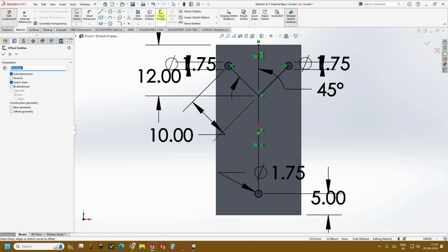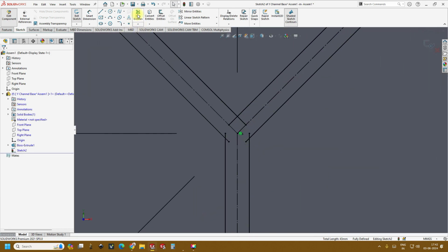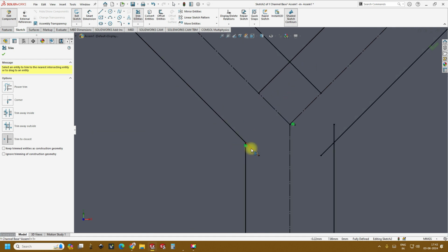You can just create an offset, and here the important note, since we had to create a closed microfluidic channel, you can just select bidirectional and construction geometry for the baseline. Since we have selected bidirectional, for example if you wanted to give a 1 mm channel, just press 0.5 mm. Since it is bidirectional, it will take both sides, so each side will constitute 0.5 mm and complete a 1 mm channel. In case you wanted to reduce it to 0.5, just press 0.25, so overall it becomes a 0.5 mm microfluidic channel. So press OK, and if you see these points, you just go to trim and remove these extra portions.